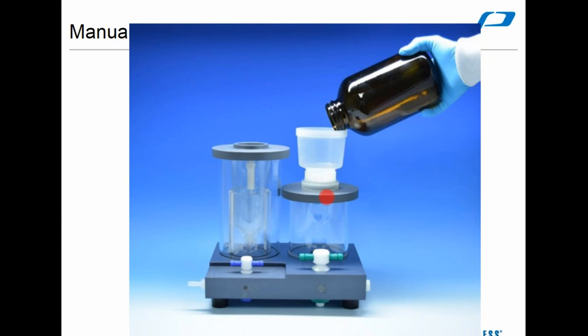The activation, or if you're using pre-activated, would be done here as well. Usually your methanol solvents will be collected there in your aqueous waste. You'd need to segregate this waste as having solvent in it as well. We also have the option of large one-liter glass funnels which will be available to use there. We won't have the housing with the disc that attaches onto it. You would use the same gasket with screen with the stainless steel screen underneath.